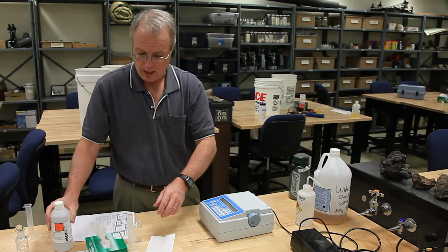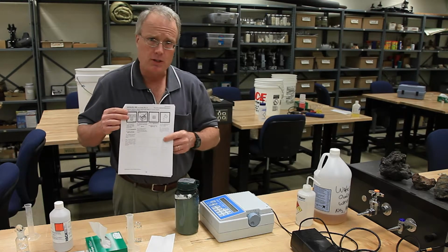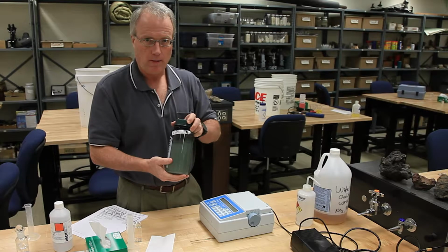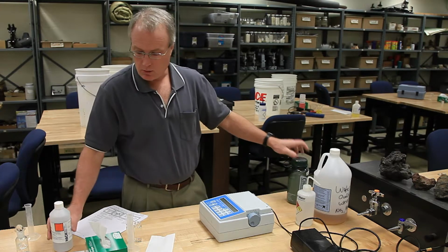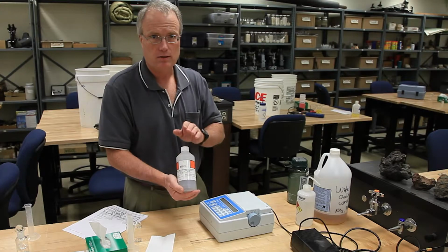and when you are complete with all those QC steps, you can set all this stuff aside, and then you repeat these exact same procedures, except now you're doing it with your sample, with your unknown river water. And we will believe the number that this machine gives us for this sample because we just confirmed that it gives us the right answers for this standard.